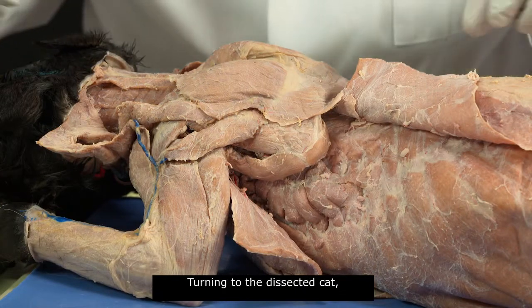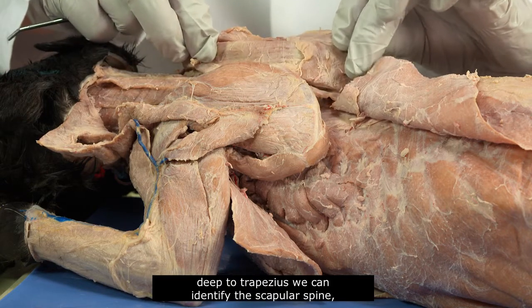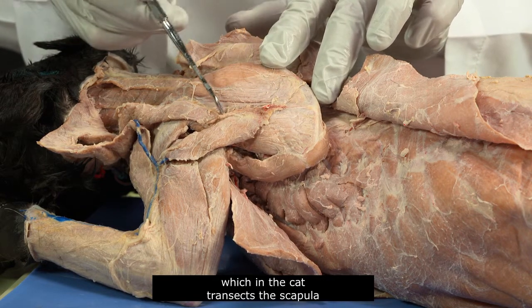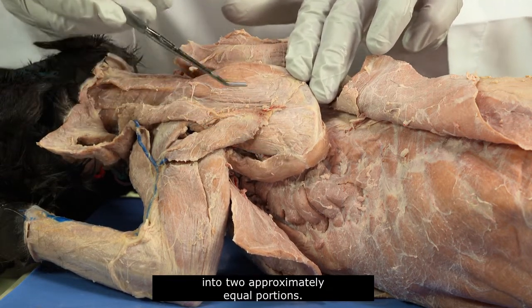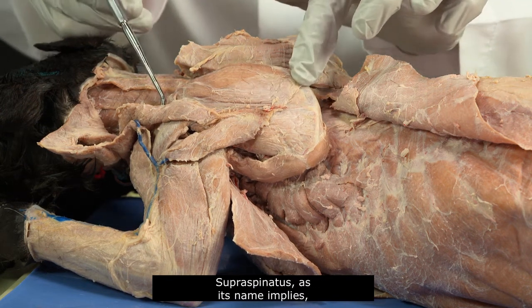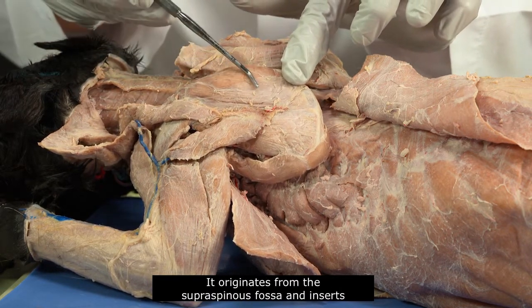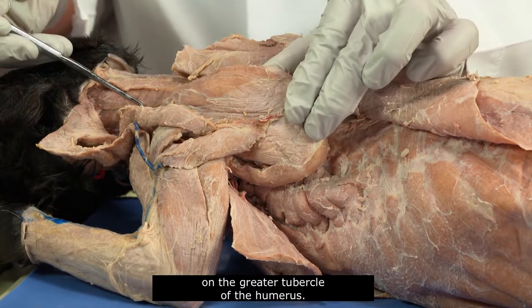Turning to the dissected cat, deep to trapezius, we can identify the scapular spine, which in the cat transects the scapula into two approximately equal portions. Supraspinatus, as its name implies, is located above the scapular spine. It originates from the supraspinous fossa and inserts on the greater tubercle of the humerus.